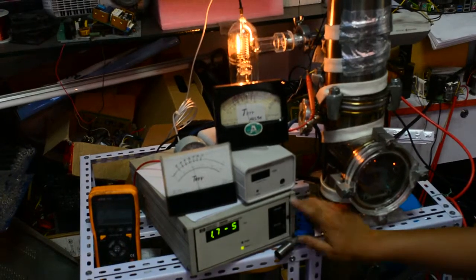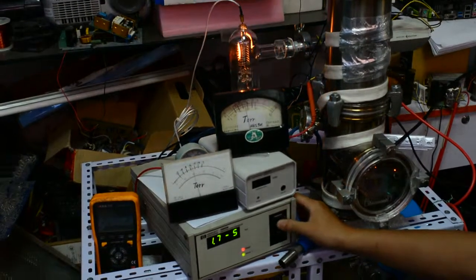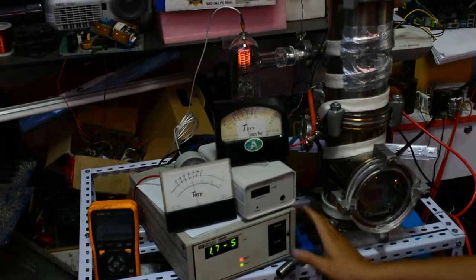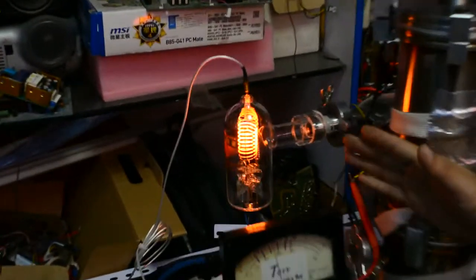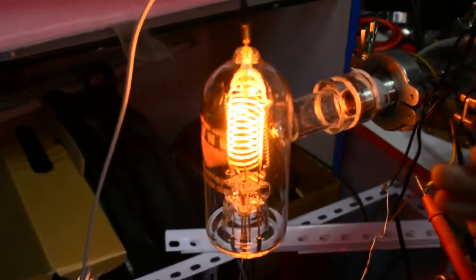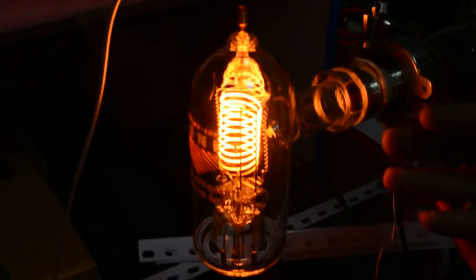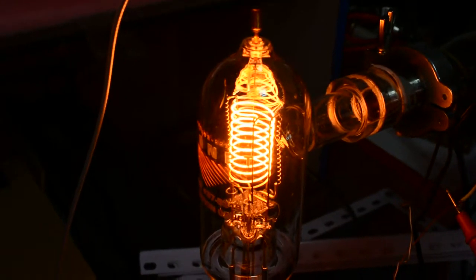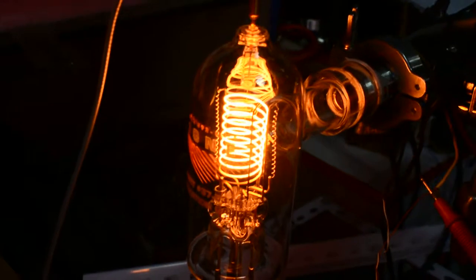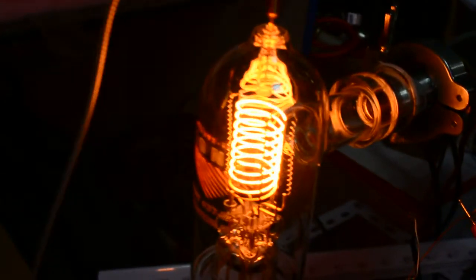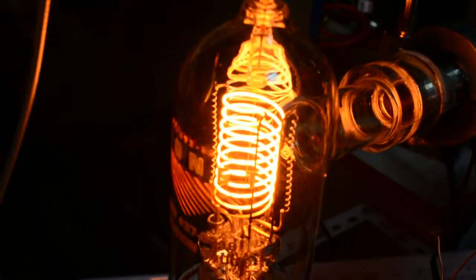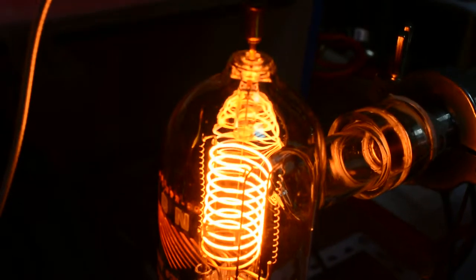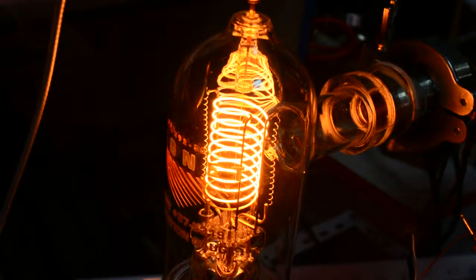By pressing this button, it is automatically shut off the filament and apply a very high current to the grid. The grid is heating up to red hot to drive out the gases or other things. You can see here.